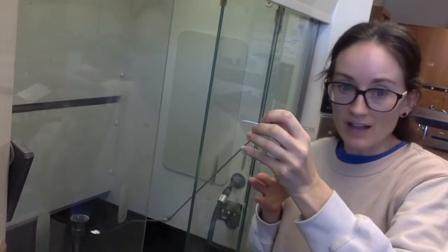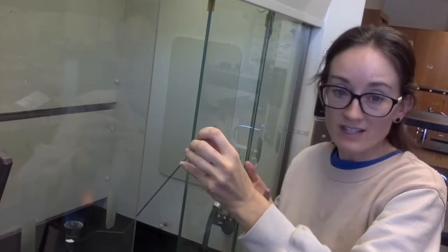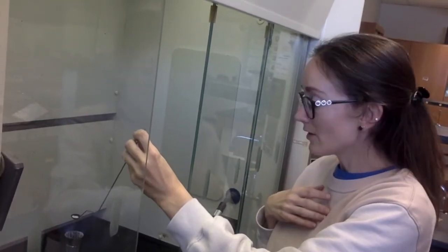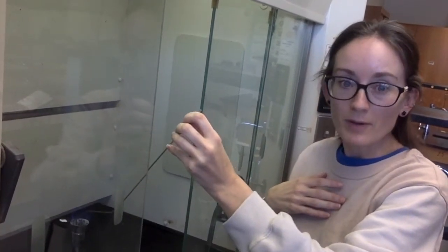It's the same solid substance. Nothing has happened, so it has a high melting point. It needs a high amount of energy in order for it to melt, which it's not getting. Decomposition would mean it would have started to melt and then likely burn. It's not doing either, so it does not decompose.